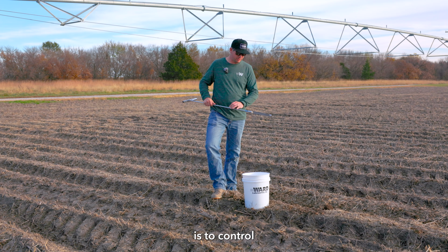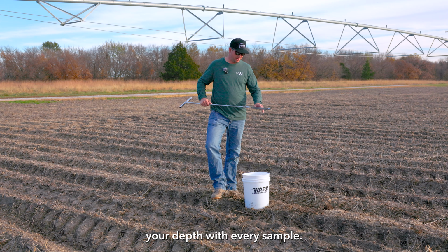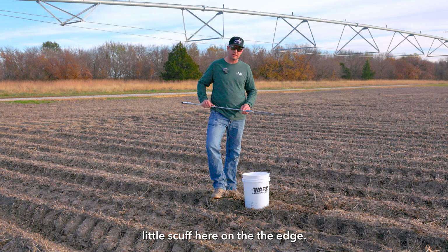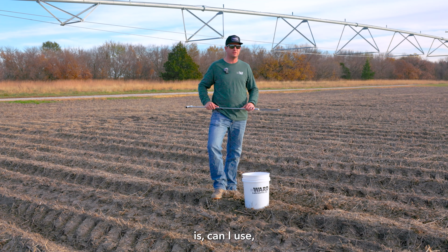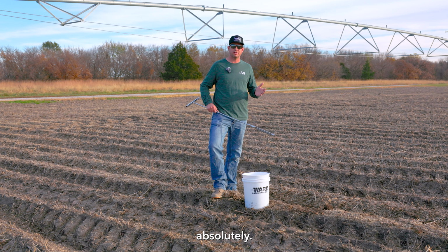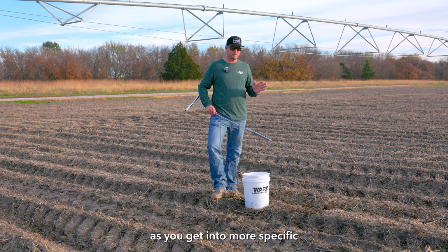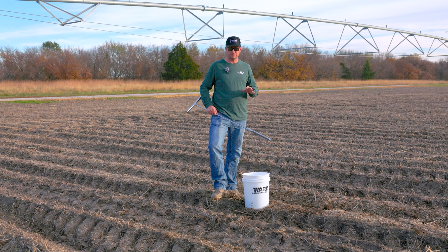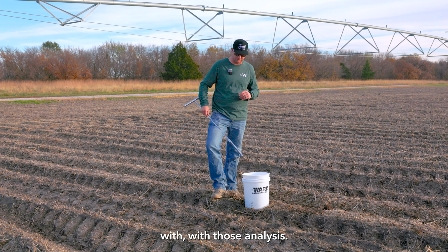Most critical thing is to control your depth with every sample. The probes that we provide from Oakfield have hash marks at the 6-inch mark, so I know I'm going to go try about 2 inches over that. I have a little scuff here on the edge. Common question when soil sampling is, can I use WD-40 or some other lubricant? We say generally, absolutely, especially dealing with nutrient samples. As you get into more specific biological analysis, say nematodes and or PLFA, we'd probably ask you to not use a lubricant just to prevent any interferences with those analysis.